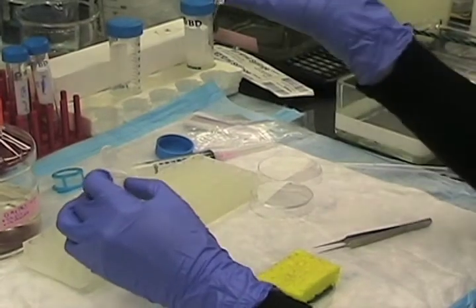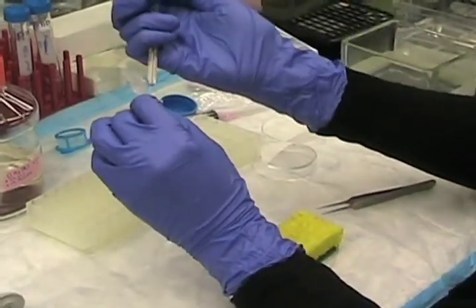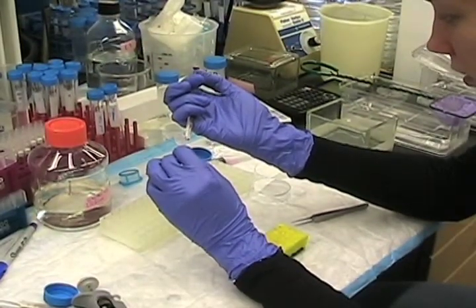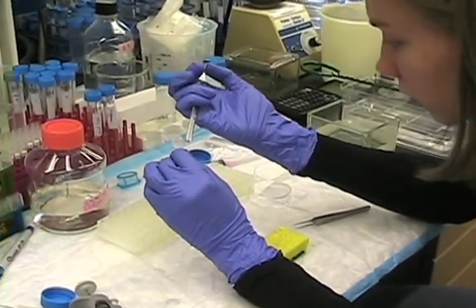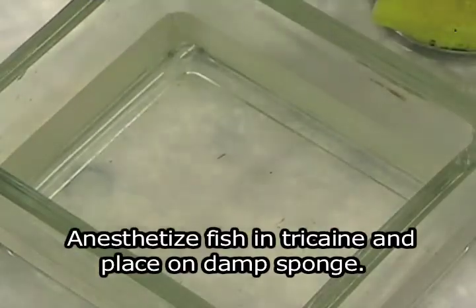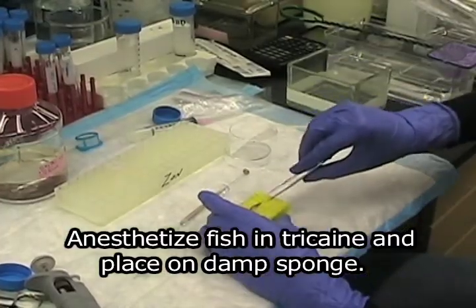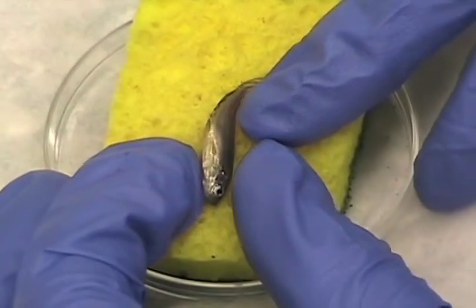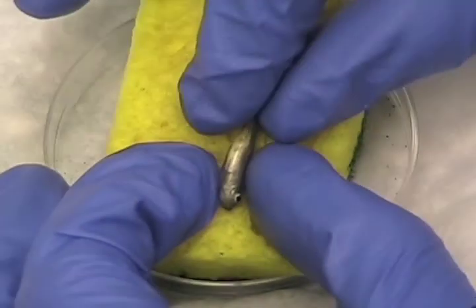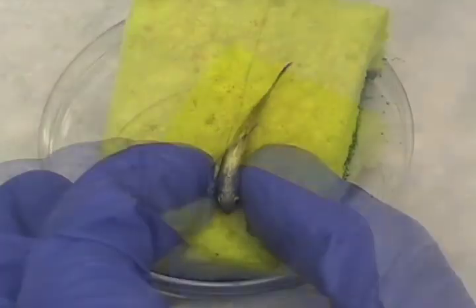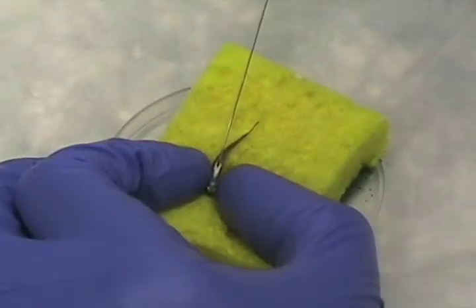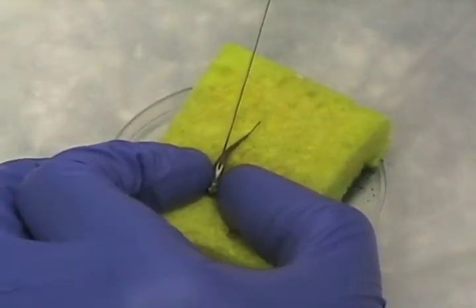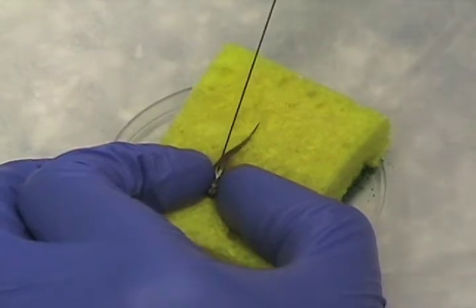I'm going to fill the syringe up with cells to 5 microliters, making sure that there's no bubbles in the syringe. The fish will be anesthetized in tricaine before injection. For the injection, inject 5 microliters of the whole kidney marrow and peripheral blood solution into the heart of each recipient using a Hamilton syringe.